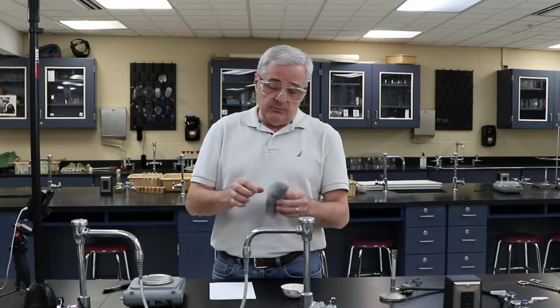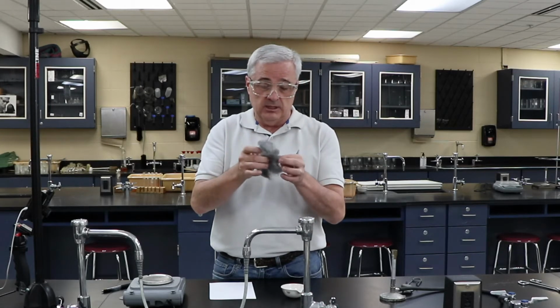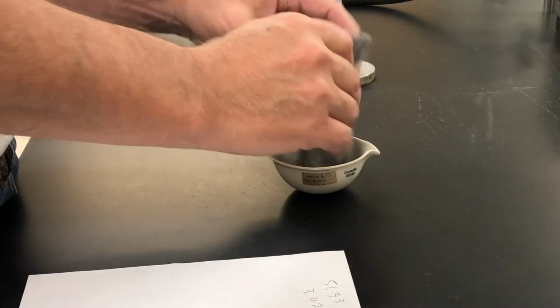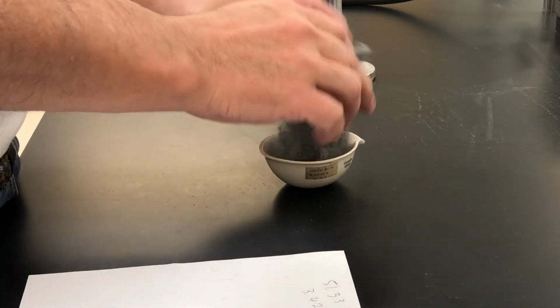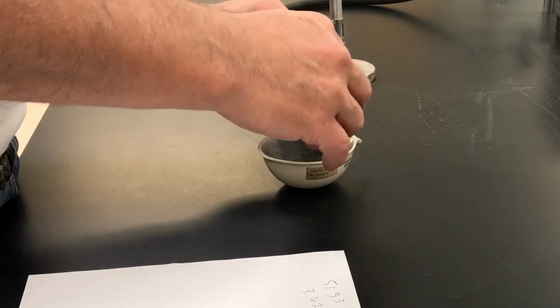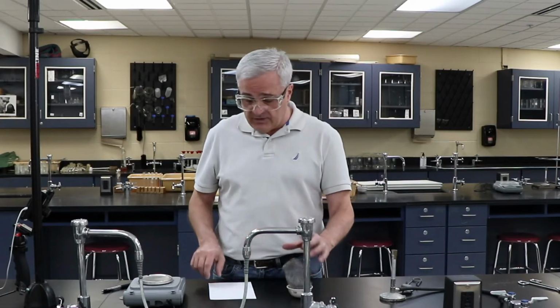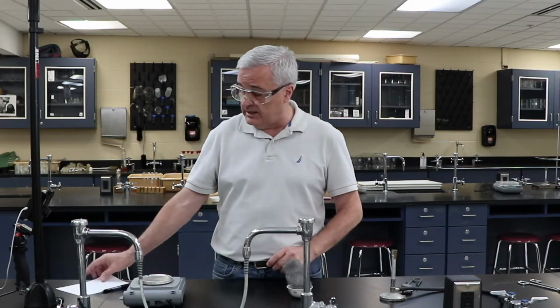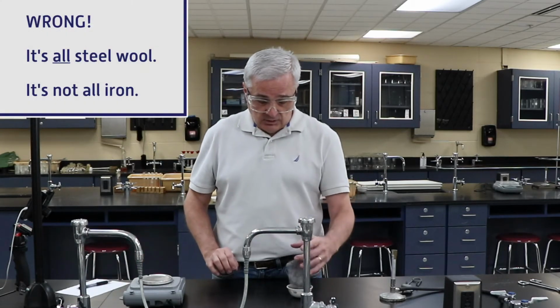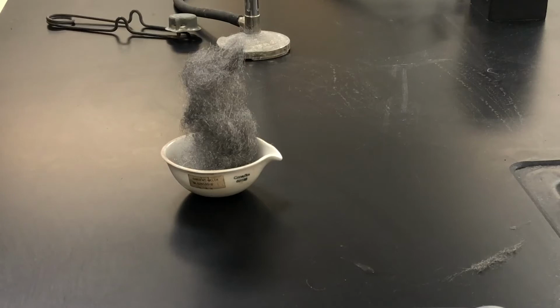Now here's the hard part of this. We need this to be fluffy so that there's a lot of room between the strands of steel wool, but we also need it to fit inside the evaporating dish. There's going to be several errors in this version of the lab. One is we don't actually know the composition of this, so some of that 3.42 grams is not steel wool. I've already lost some of my sample onto the surface around it. A small amount of the steel wool fibers has come off.